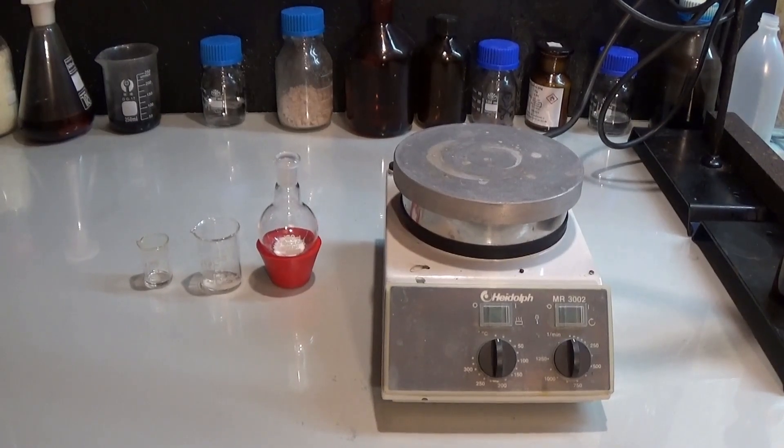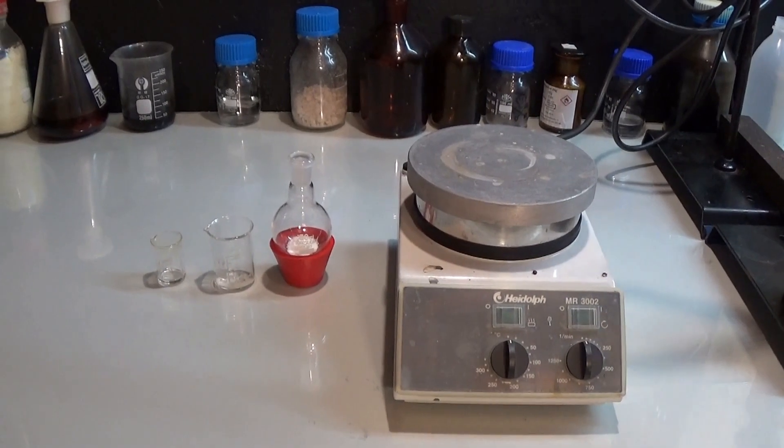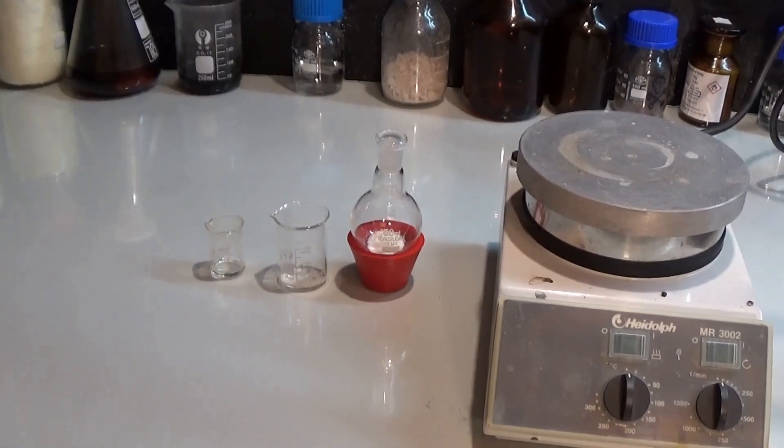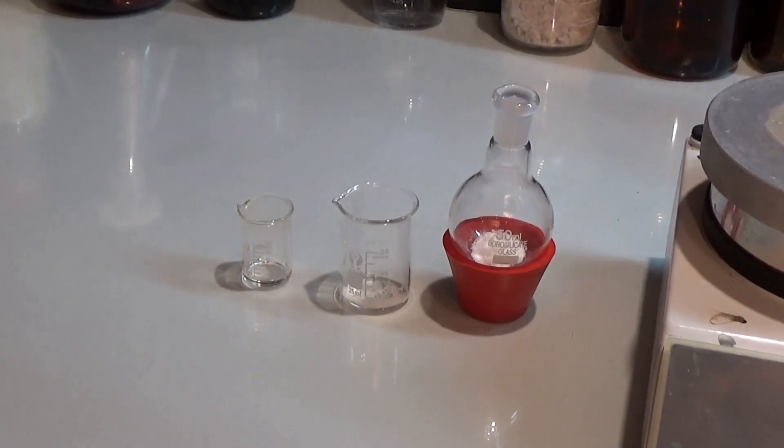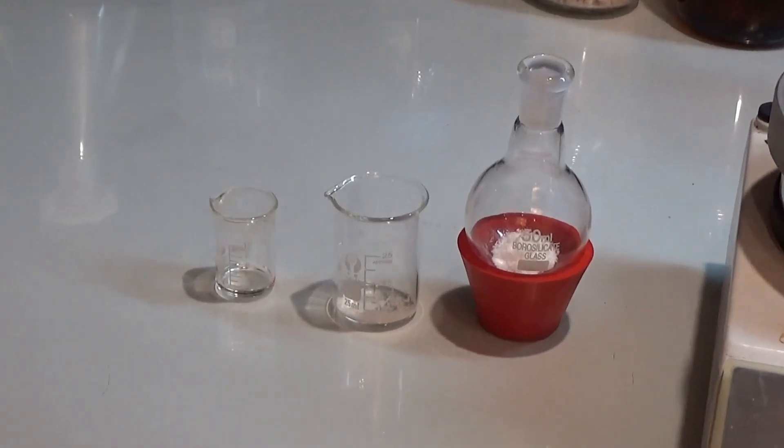But back to the video. Here you can see all of our reactants. On the left the bromobenzene, in the middle the sodium hydroxide dissolved in some acetone, and on the right the vanillin.